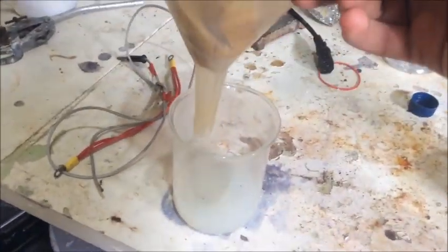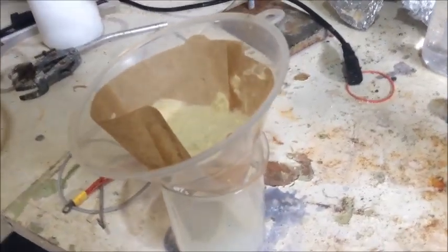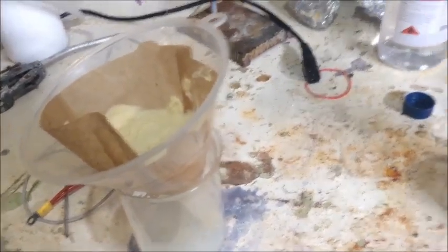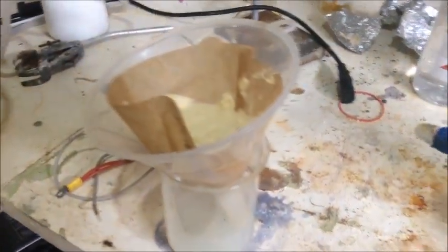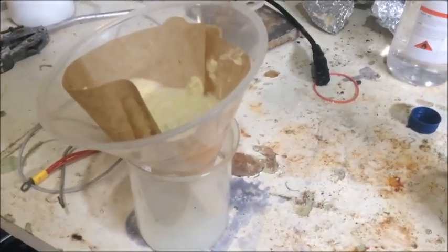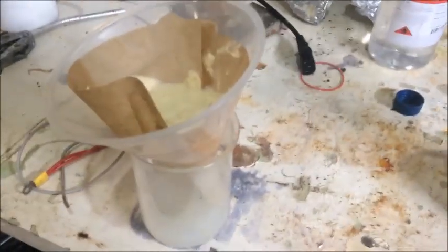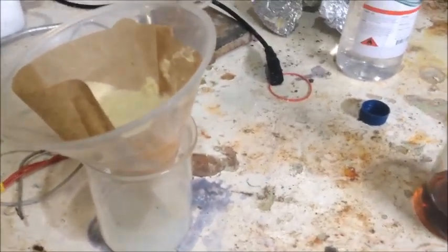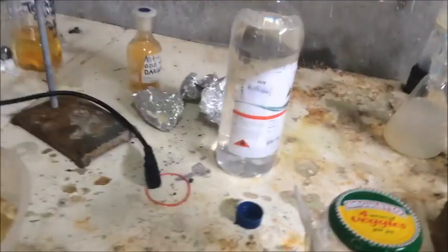This here is some salicylic acid, which is being gravity-filtered. I'm doing that not really for the channel — I'm actually just doing that with my girlfriend. We're making some esters, starting off some basic chemistry, because she dropped out of chemistry in year 10 because she hated it. And now, I don't know, this is karma punishing her — she gets a boyfriend who's obsessed with chemistry. So, this is salicylic acid, and I finally got some methanol — this was actually only $2 a litre.